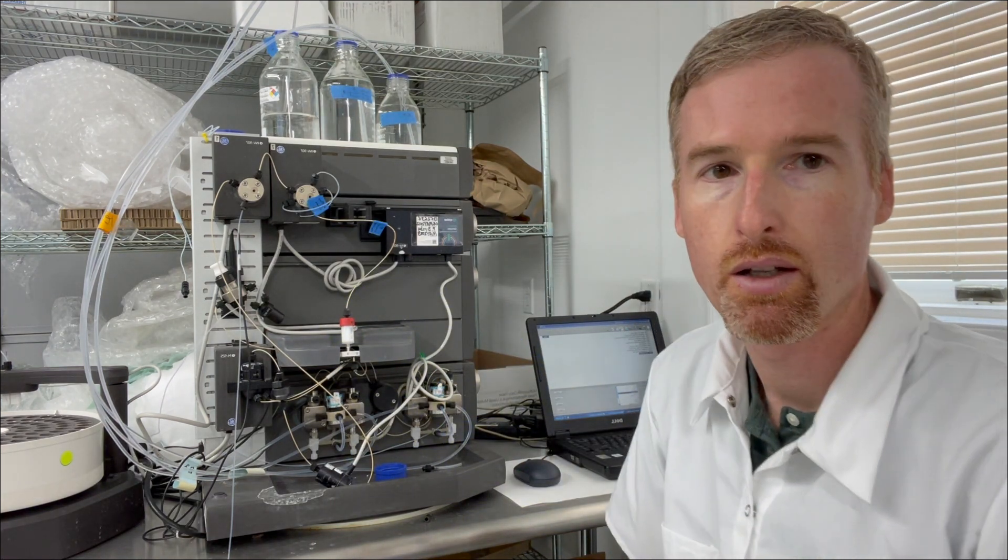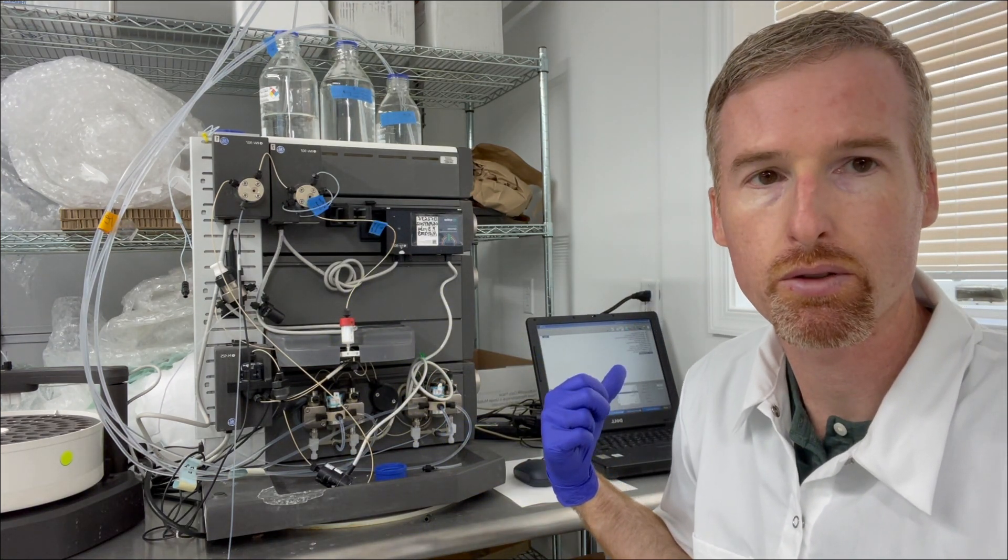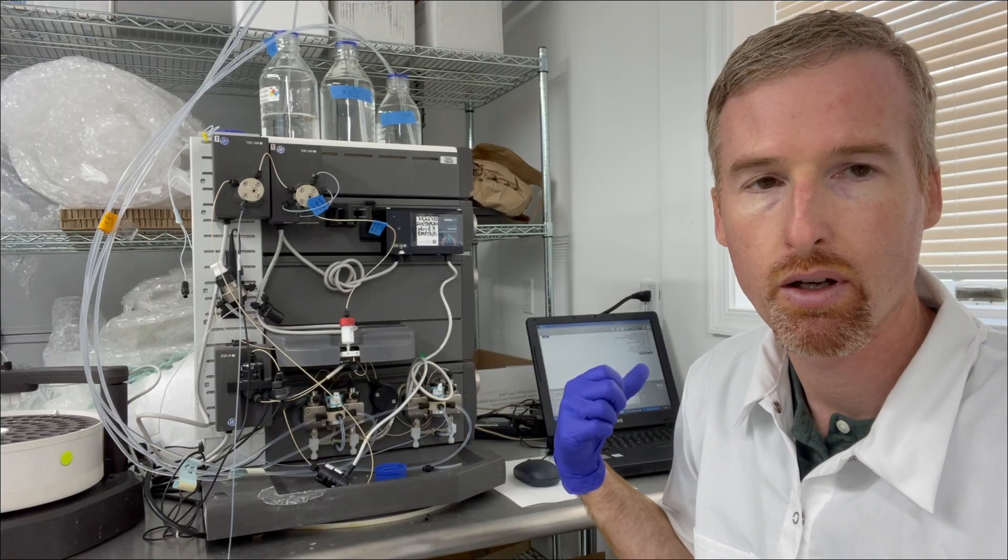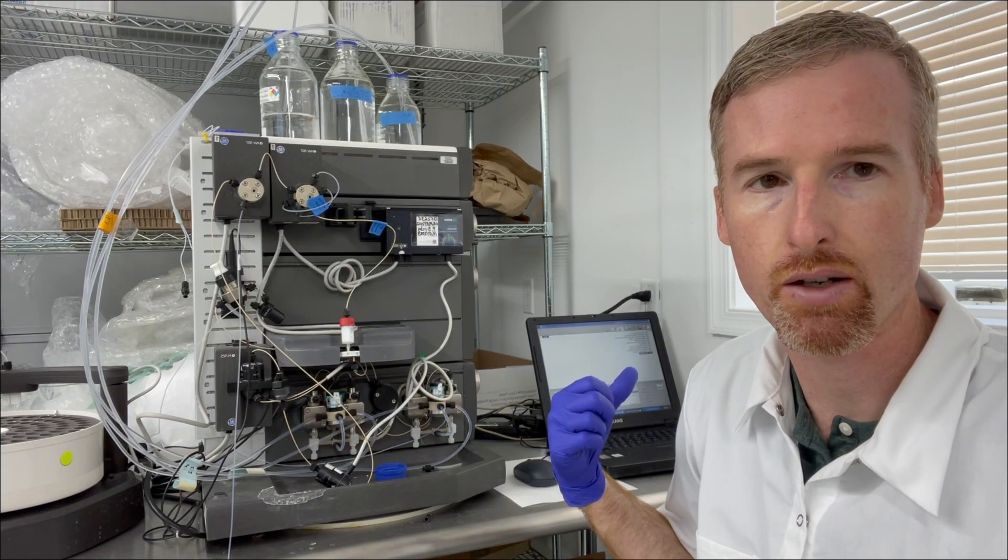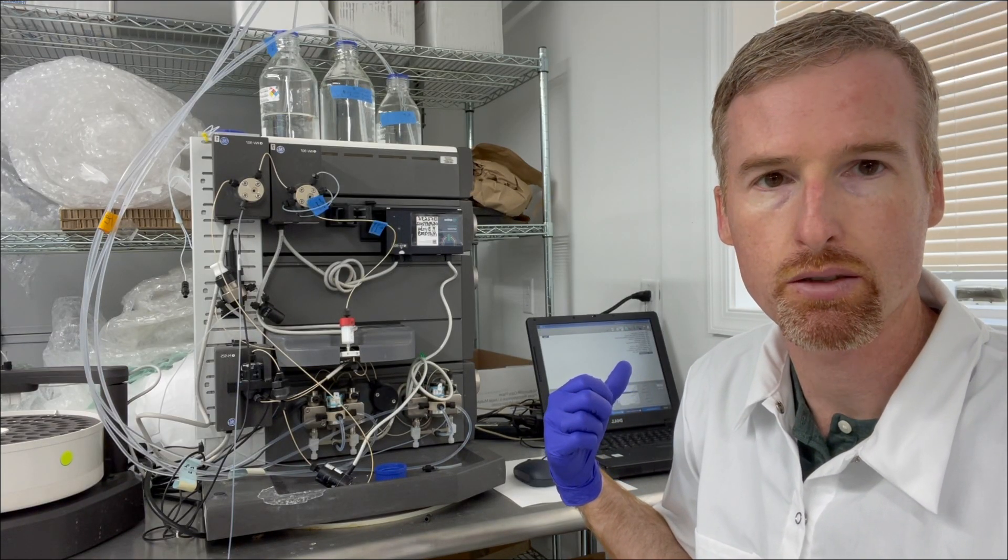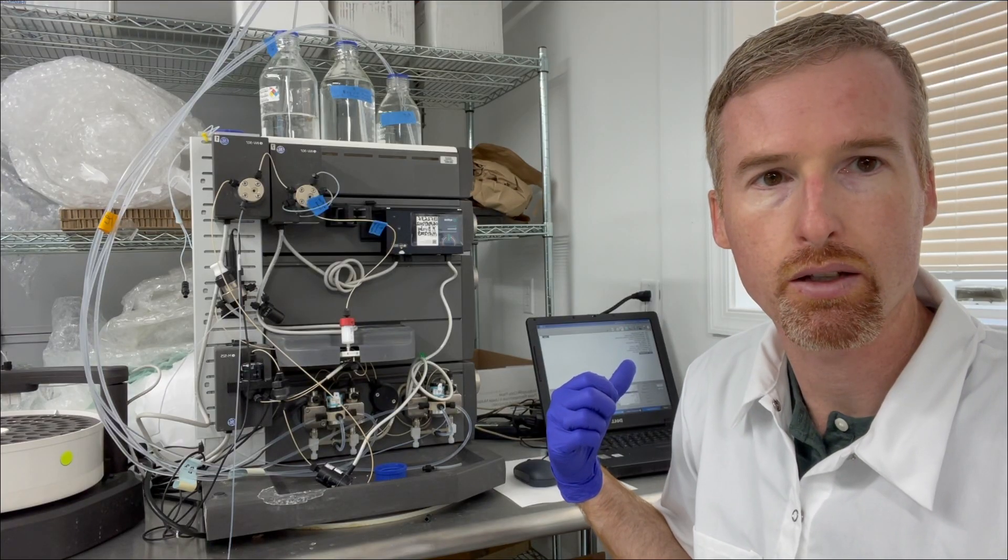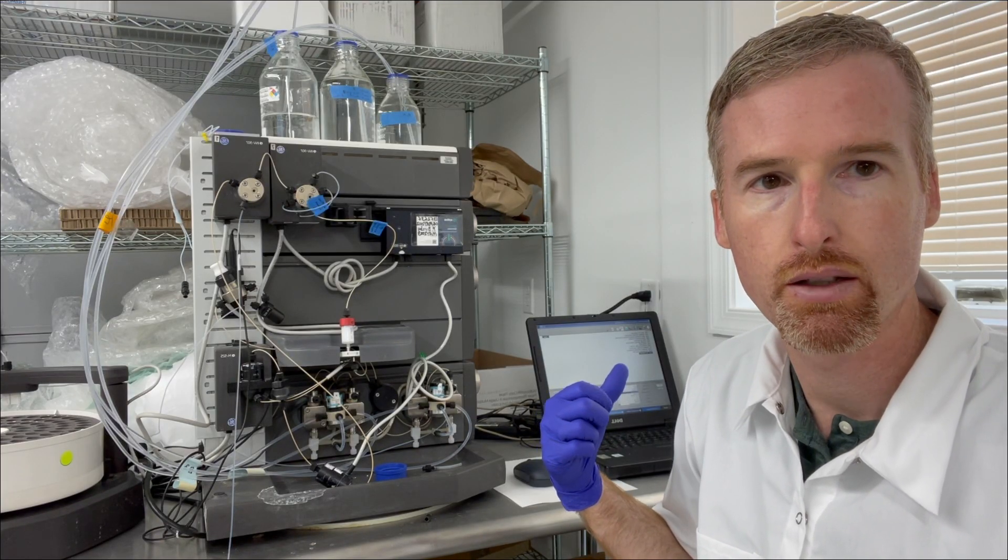Connect it at the top as well and then what I'm going to do is I'm going to control the pump manually with the Unicorn software. I'm going to tell it to give me a gradient of 100% A.